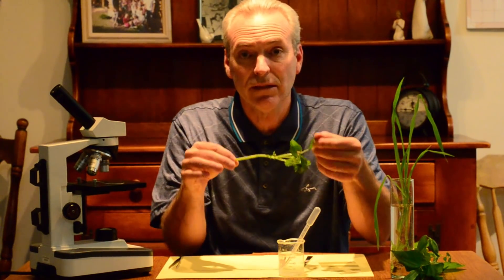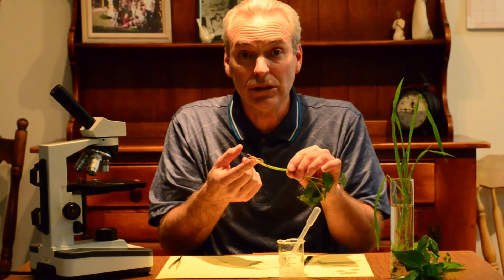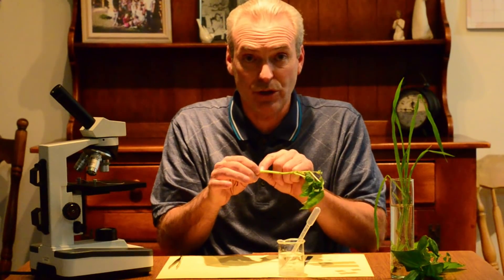So what we want to do is take a look at the stem today. We want to look at the leaves. We want to look at the roots. We want to do that through a cross section and also a longitudinal section.